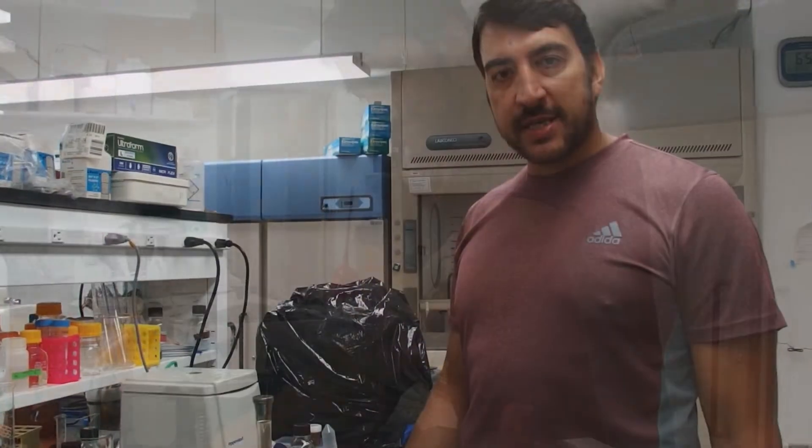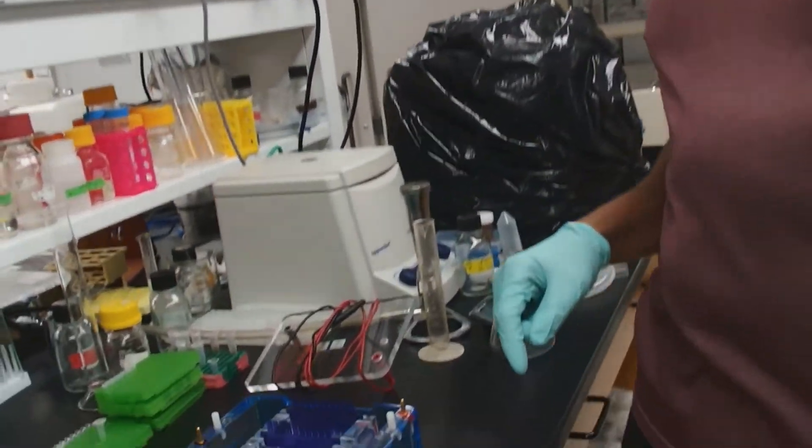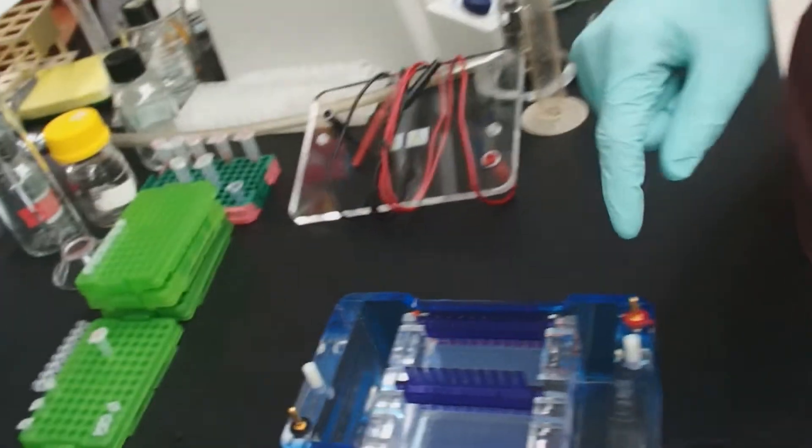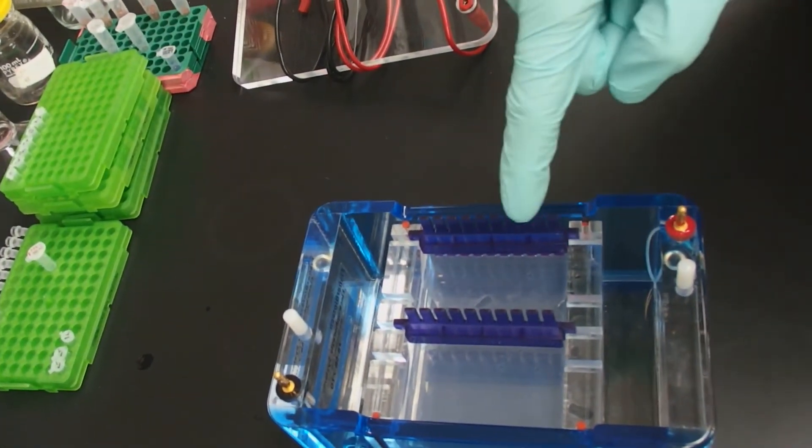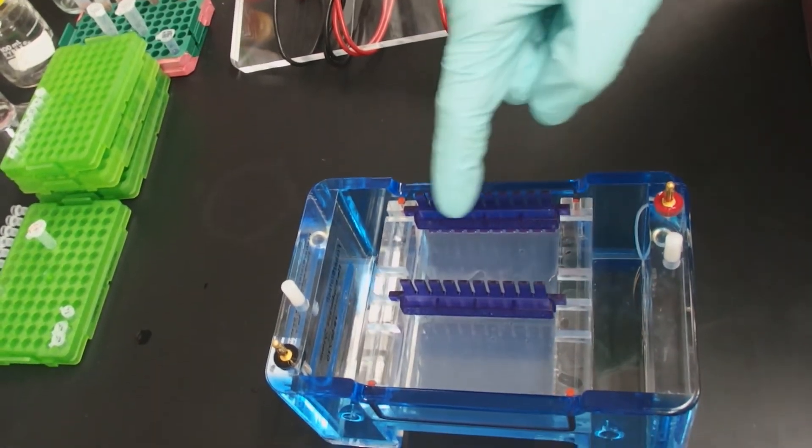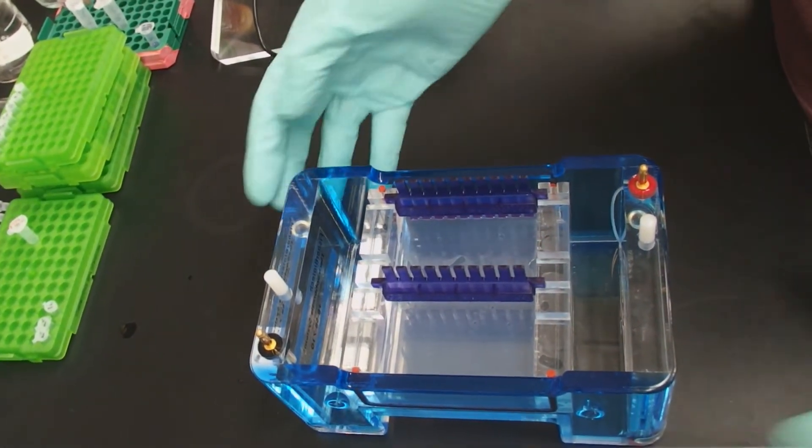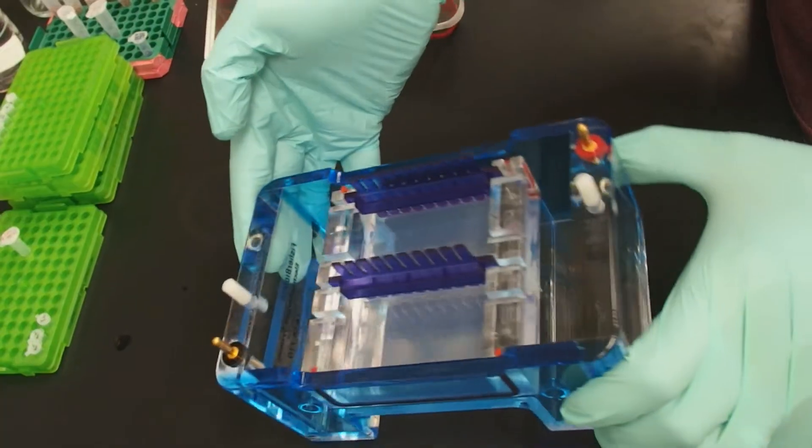Now our gel is solidified. And you'll be able to tell that it's solidified because it will change from being perfectly clear to being slightly translucent. As you can see here, now it's slightly translucent. And if I move the gel box, you'll notice it doesn't move anymore. So it's completely solid now.